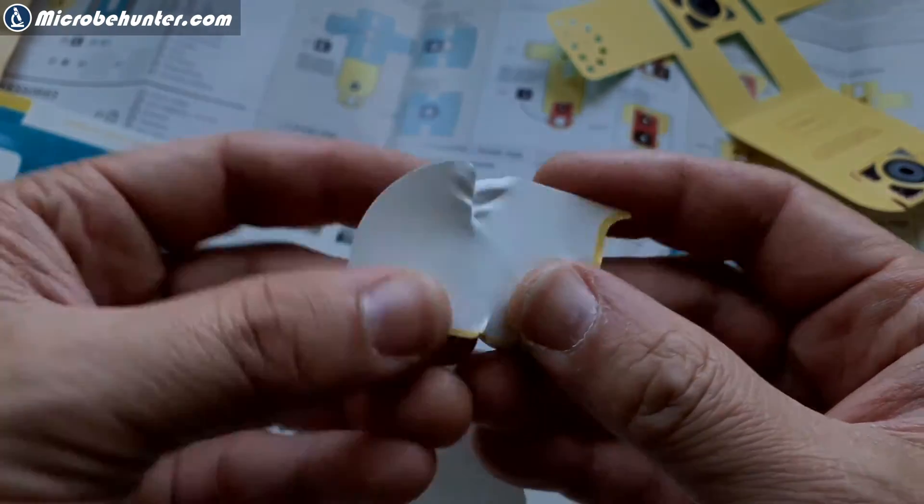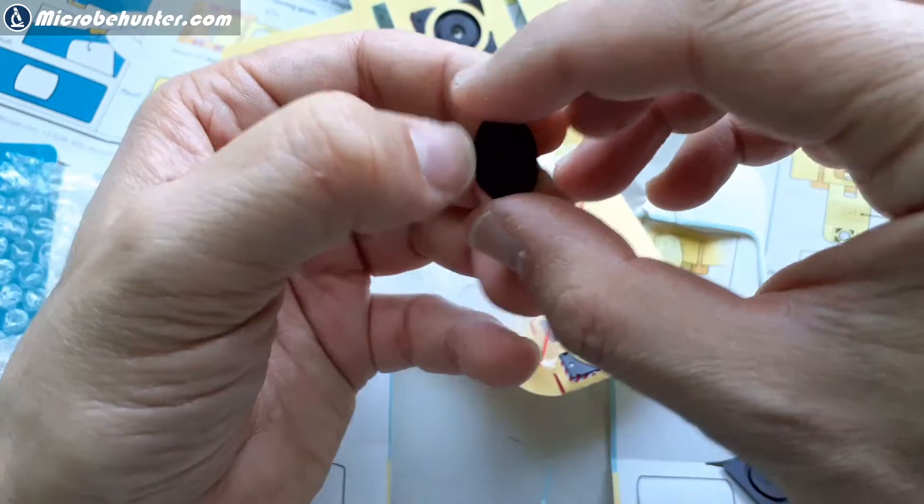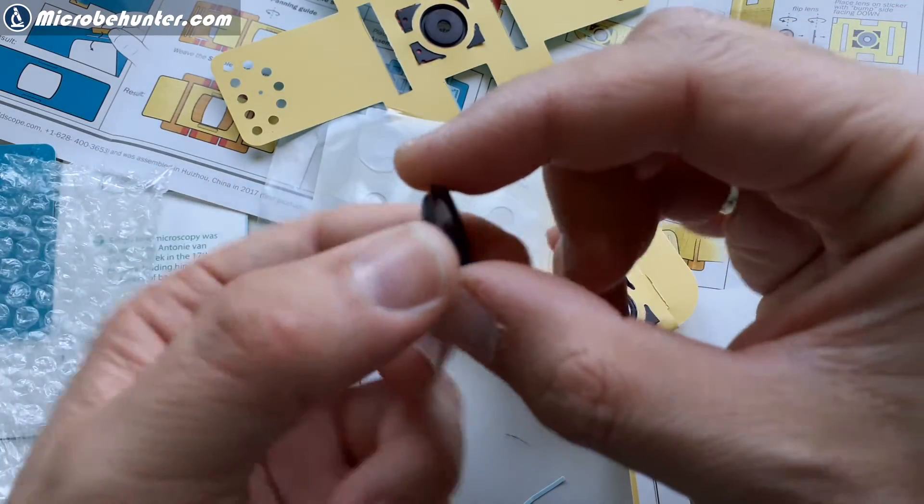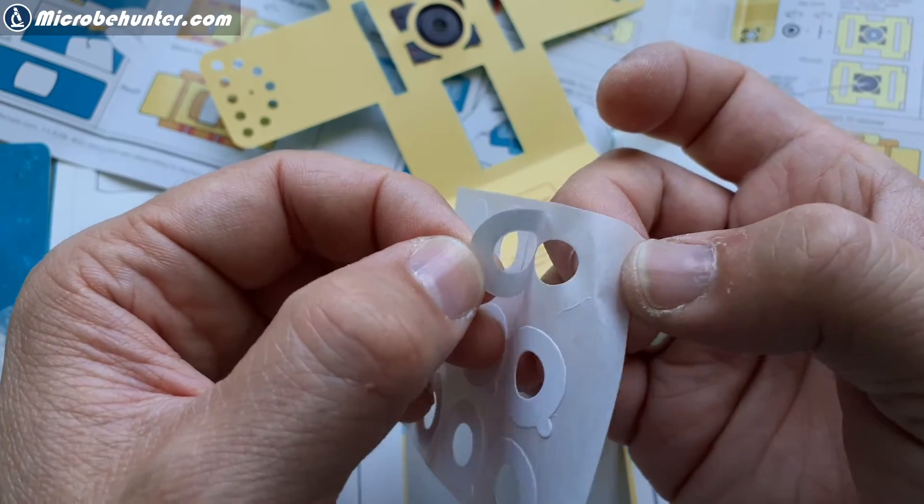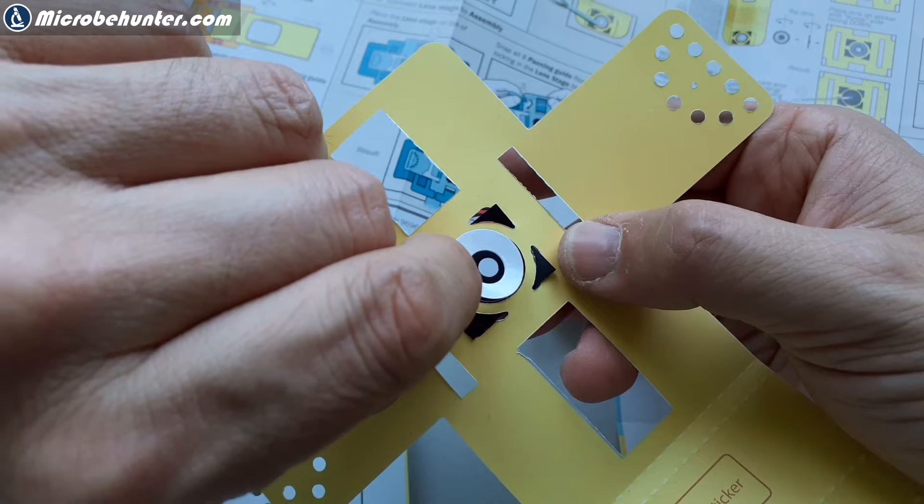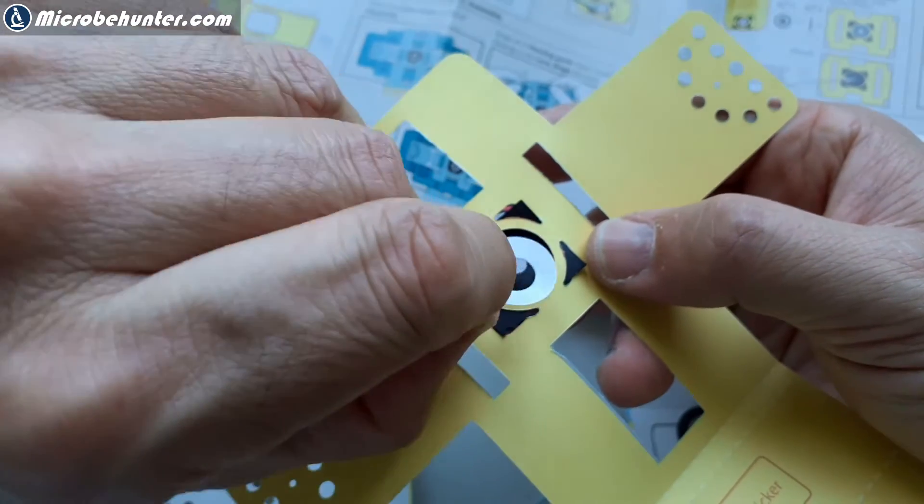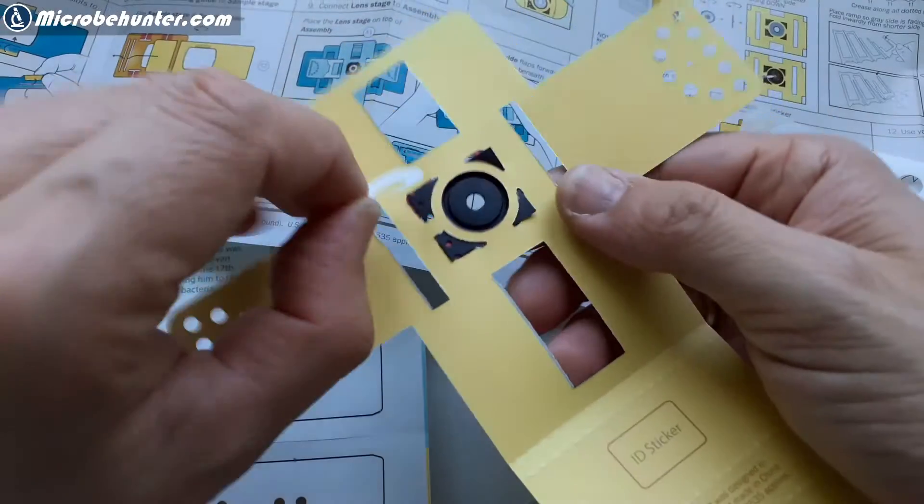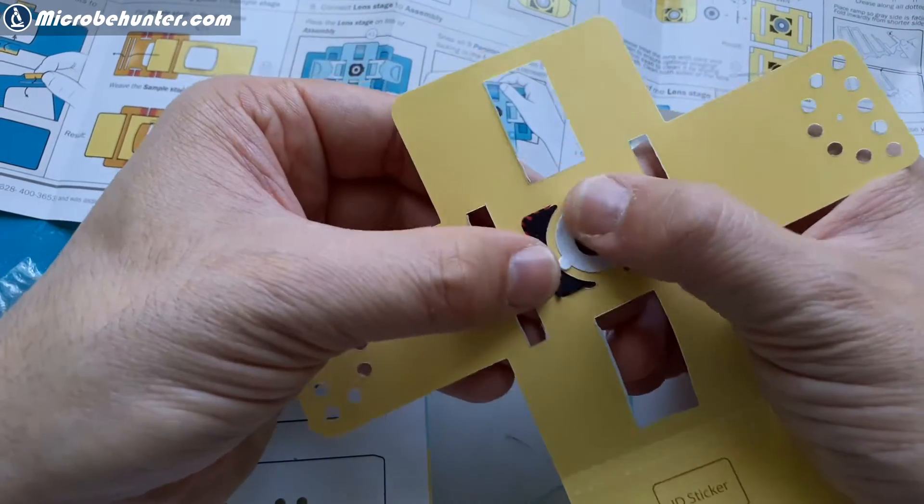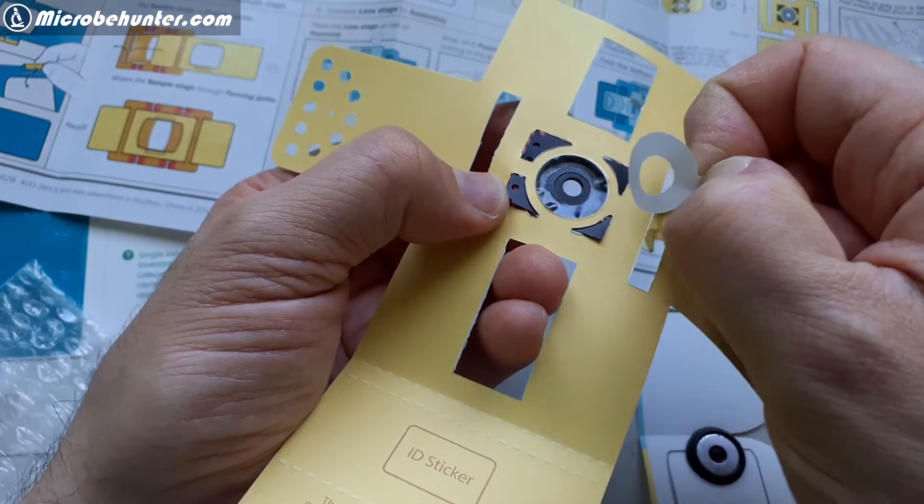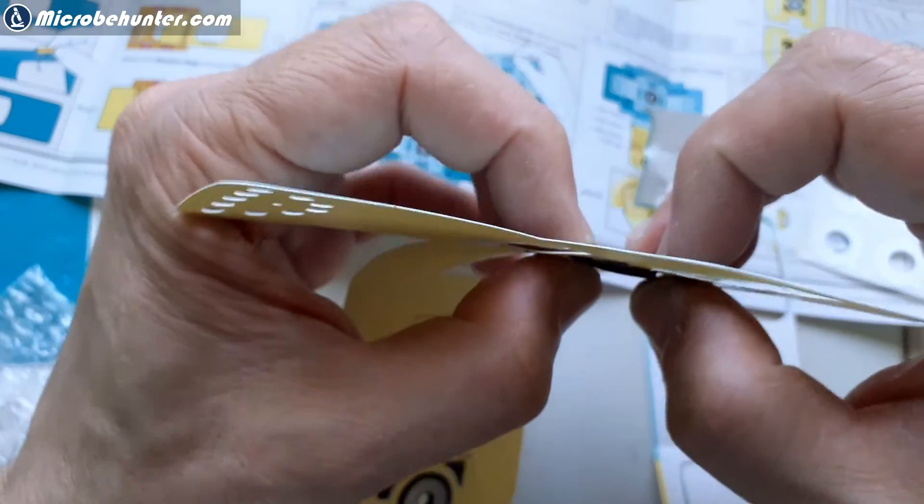Well, later on, I'm going to show you anyway how I take pictures. This is the lens. I thought that at the beginning that they forgot to include the lens until I saw that it was actually also connected there also over a magnet. It's pretty tiny. I mean, it's a single lens microscope, just like the Leeuwenhoek microscope is, was. And this is a double-sided sticker. You have to be careful of when removing it that the glue, the sticky side, also goes off with it. Then you have to connect it not only magnetically, but also using the sticker. So I was kind of a little bit worried about getting it properly centered here. So it's both held, the lens is held in place both by the magnet and also by this double-sided tape. You have to peel off, and then it's double-sided and then this one connects. The instructions are very clear into which direction you have to insert the lens. There's only one good way anyway how it fits together.